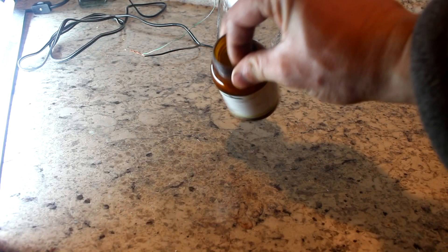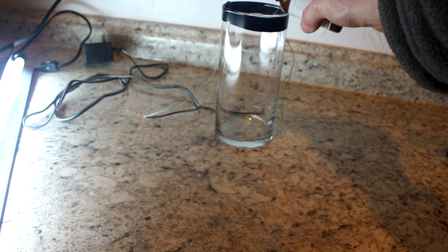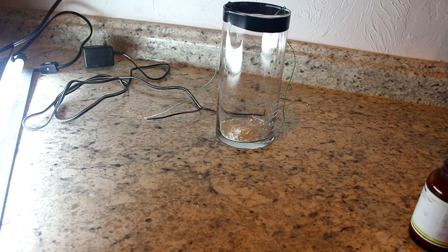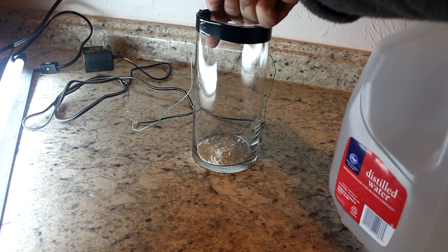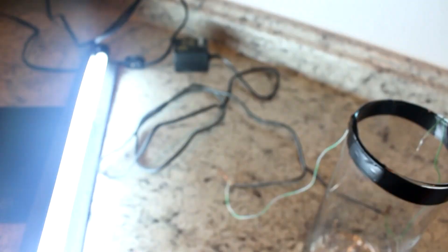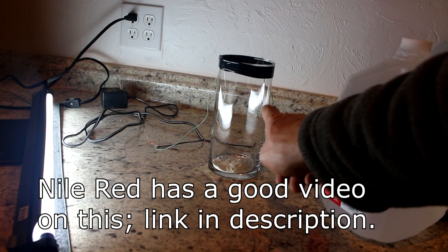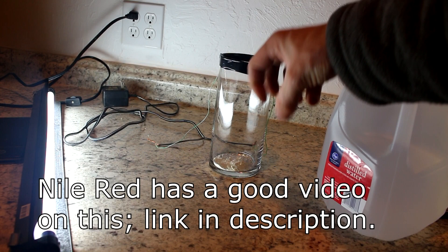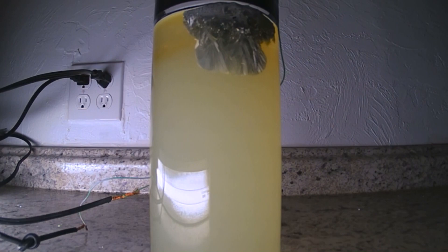Here we are with the better camera. I've got a jar of stannous chloride — the label's kind of faded because it's an old jar, but it's still good. I'm going to put this inside this jar and mix in some distilled water. I have some platinum electrodes going into it — platinum wire, a shorter wire over here — hooked to a DC electrical source which I'll plug in once I get the solution in. The electricity will reduce the tin, making metallic tin at the electrode. I'll be growing a huge tree of tin crystals. It'll look rather pretty, that's why I've got a time-lapse camera here.